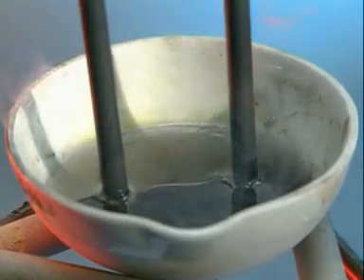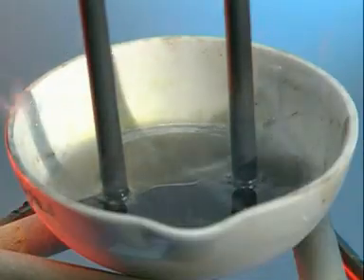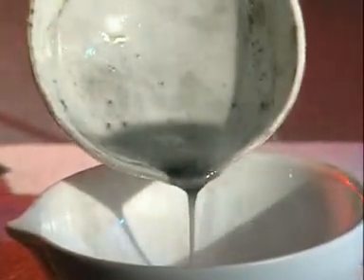Nothing appears to be happening at the negative electrode on the left. But pouring off the molten zinc chloride reveals a bead of pure zinc.